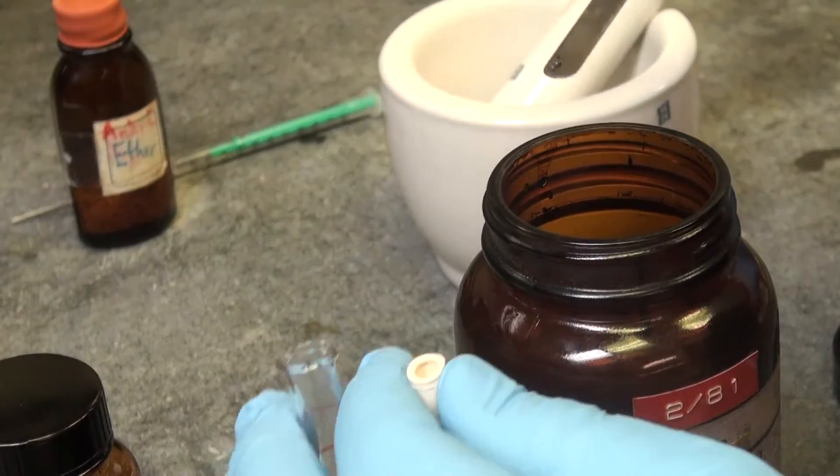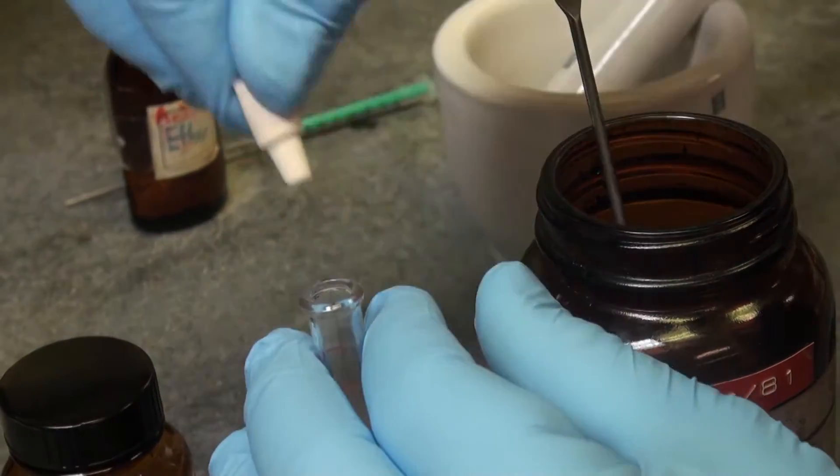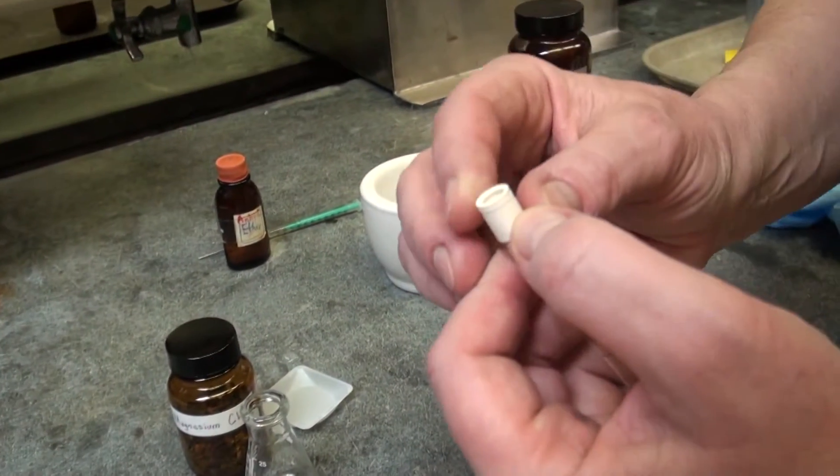Next, you want to have one crystal of iodine in the reaction tube as well and close it. So now it's time to close the septum tight.